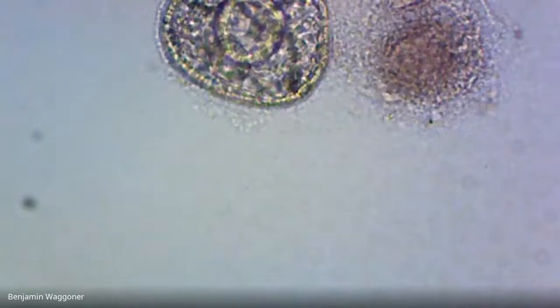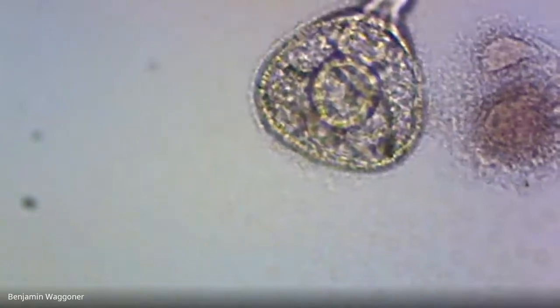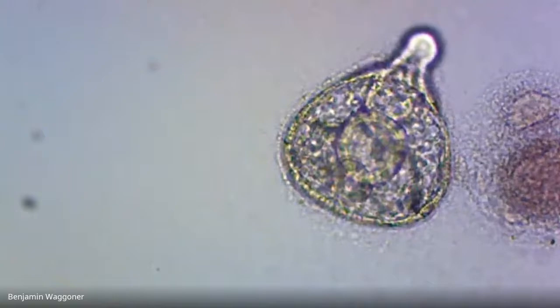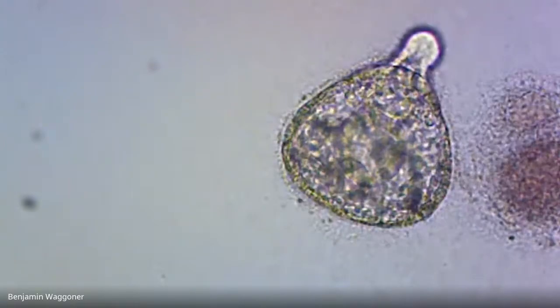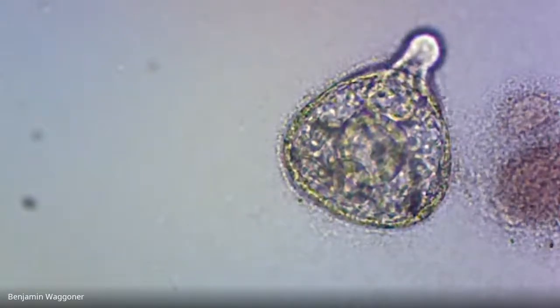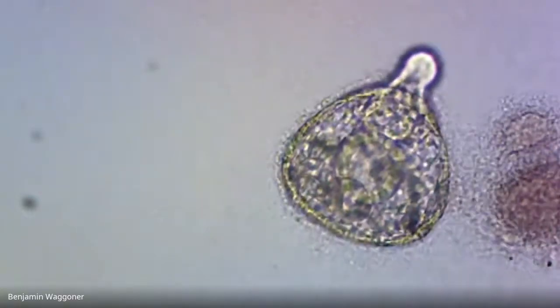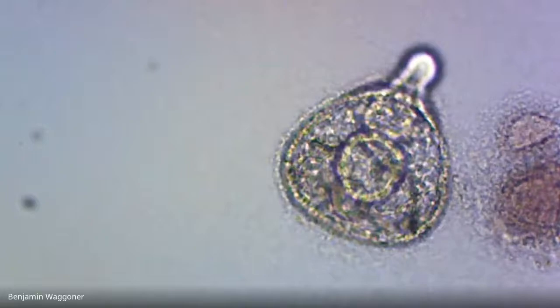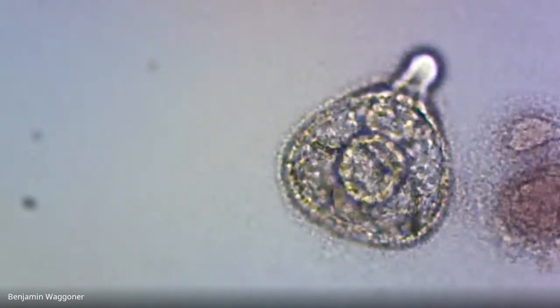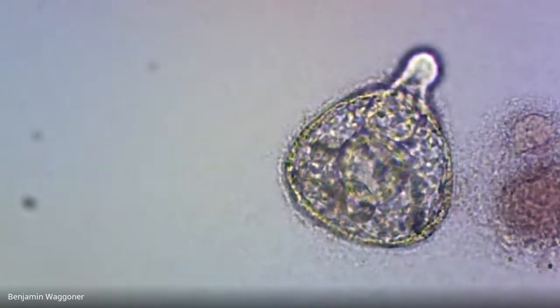Okay, there's another one that's also got bacteria mucking on it. Well, there's one to the left that I think is too wrecked to tell. But in this one, you can actually see the complete gut. There's kind of a central stomach, and then as you focus up and down, you can see the mouth ends at about the 11 o'clock and the anal end at about 5.